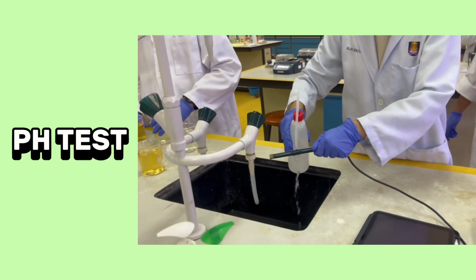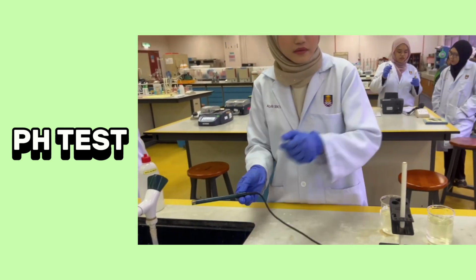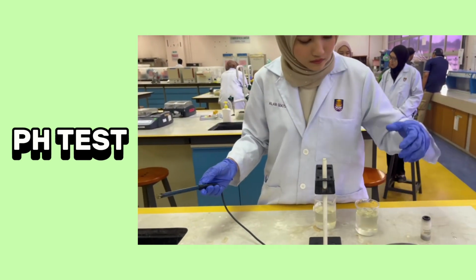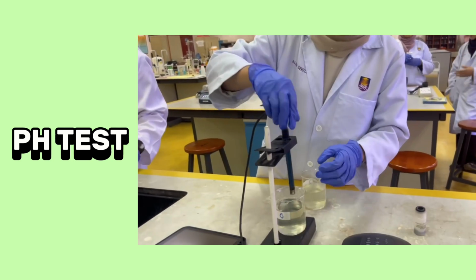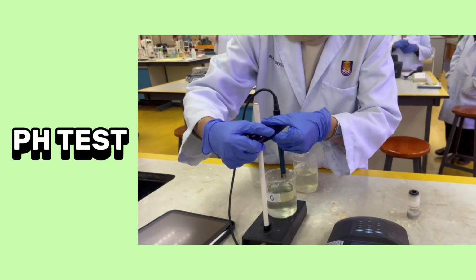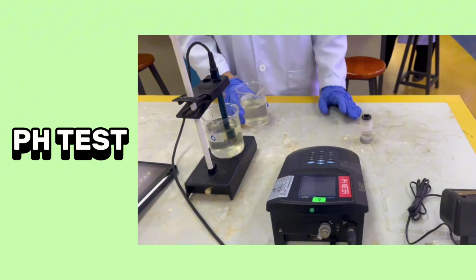To conduct the pH test, we need to rinse the probe with distilled water and then adjust the height of the probe to the desired height. Then read the pH reading at the pH meter when it has stabilized.